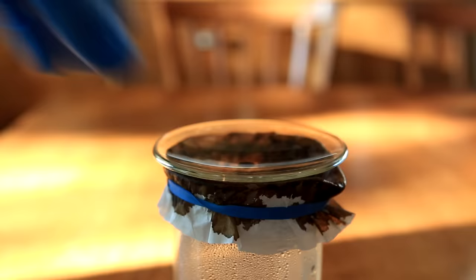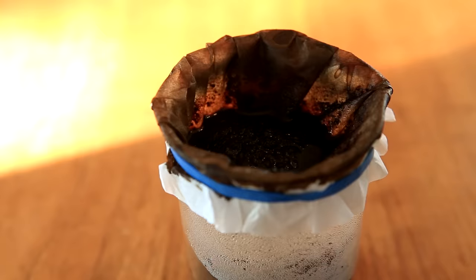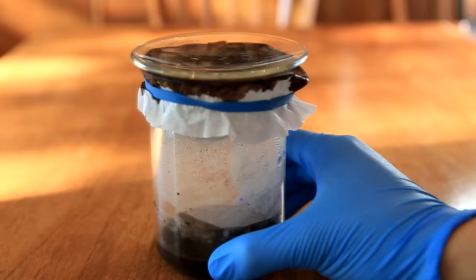A small amount of boiling water is used to wash the original flask that we soaked the coffee grounds in. This is poured in and allowed to filter through. Then once it's all filtered through, we further add 100 milliliters of boiling distilled water.